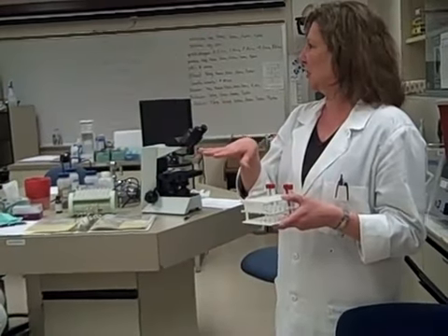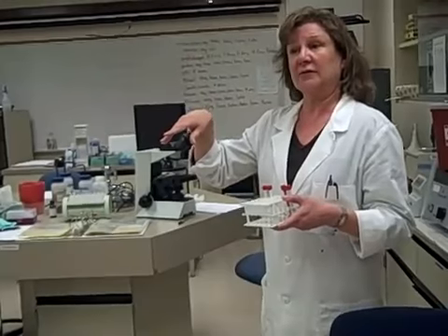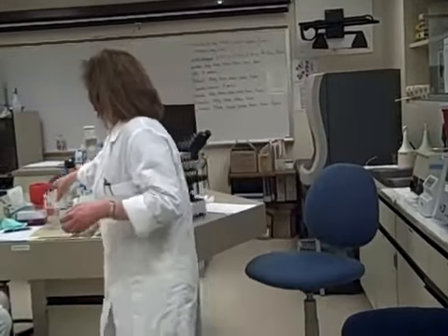When you get one plated, let me know and we'll go from there. I'll erase the board and we can write down our values up there — what we get on them — so we know how we're doing. We'll do counts on those today.